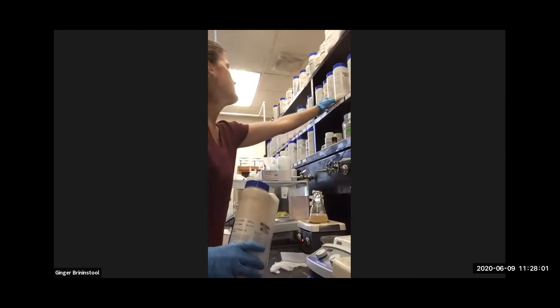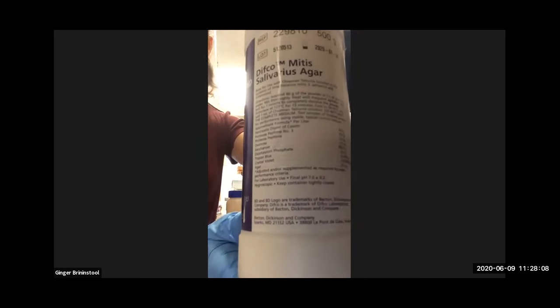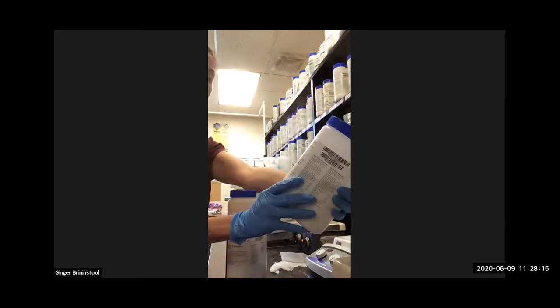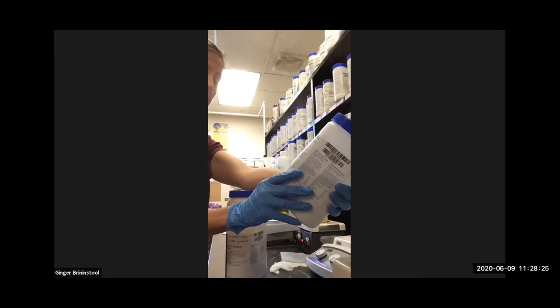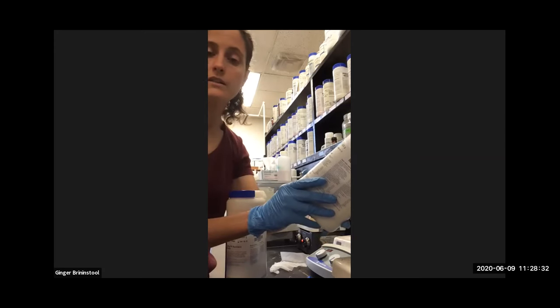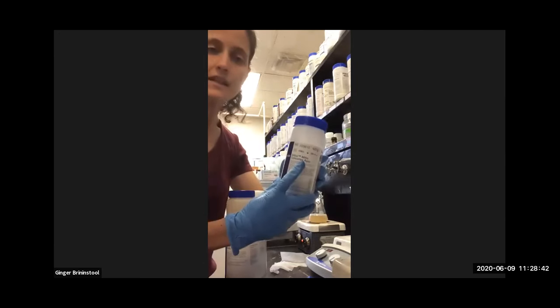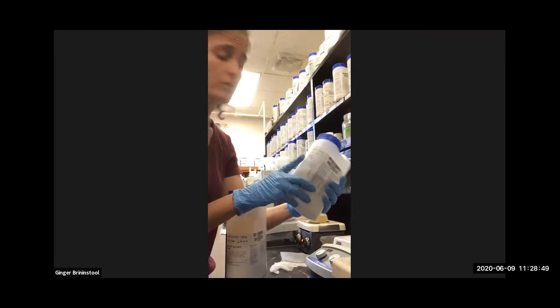Let's see, let's pick this one up here. This one's fun. Check out this agar. Look at the ingredient list on that baby. Right? So we've got pancreatic digest of casein. That's a milk protein. We've got peptone, and there are two different kinds of peptone, curiously enough. Dextrose, saccharose, dipotassium phosphate. All right. We have trypan blue and crystal violet. I wonder what color this is when it gets made. I bet it's a blue purple, huh? Yeah, it totally is. So this is Mitis salivarius agar powder that's used to make Mitis salivarius agar plates, and it is a beautiful blue purple color.